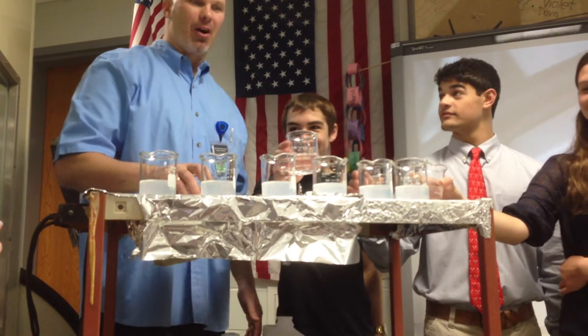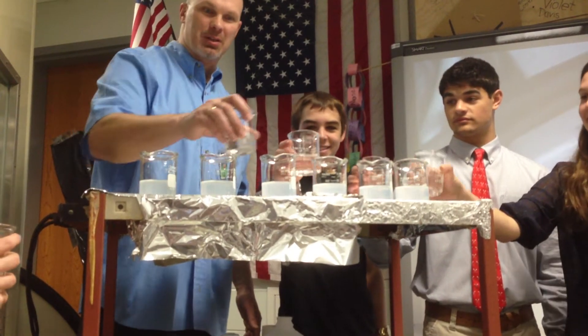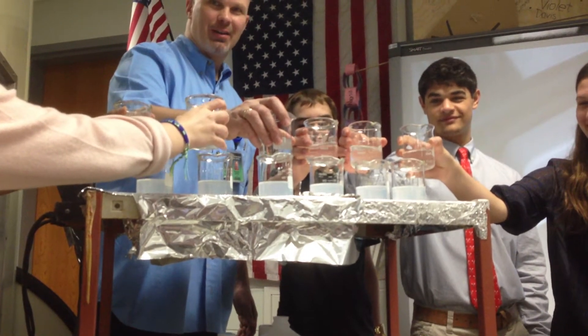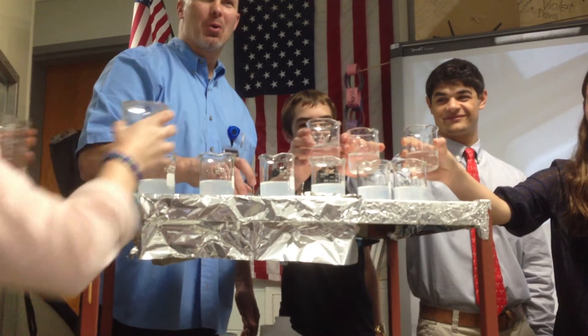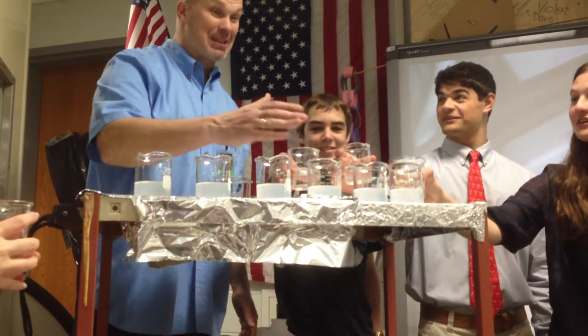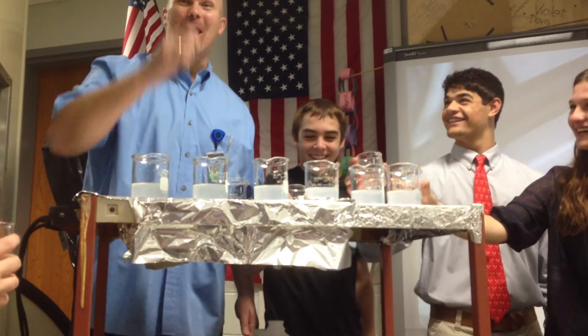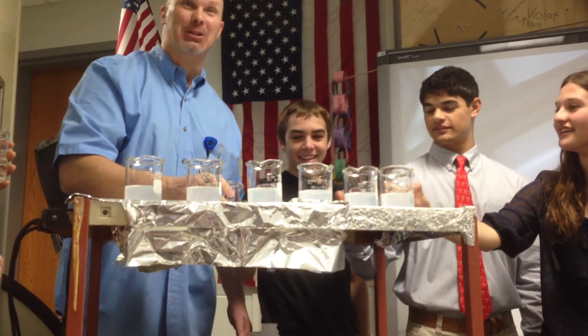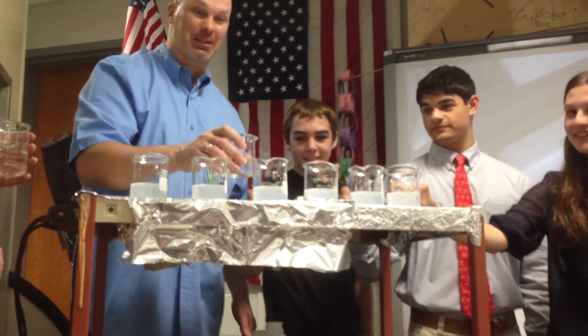So we're just testing out our concentration. So we're just going to touch — this is mine. Touch your beaker. So we're going to go one, two — not right now, we're testing. I'm going to say one, two, three, pour, and we're going to pour different concentrations of the potassium iodate solution into the starch.